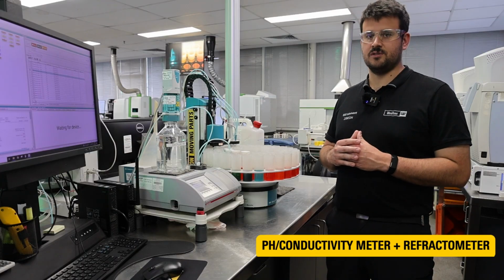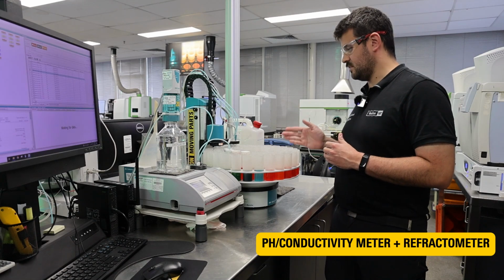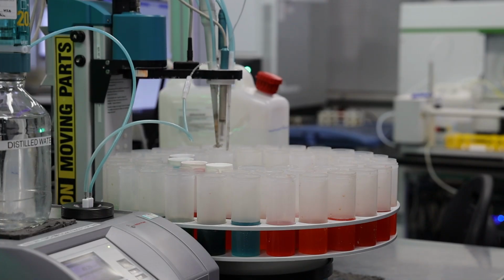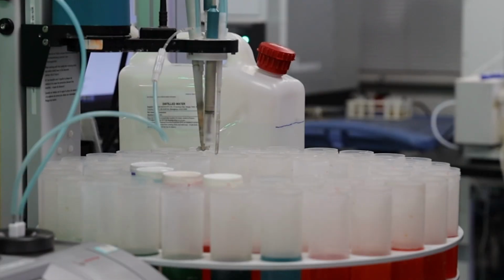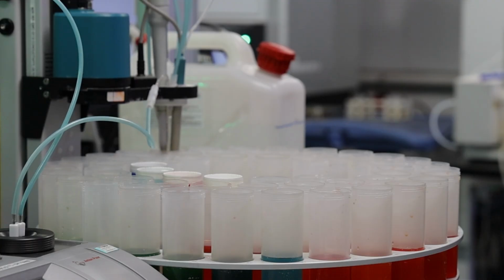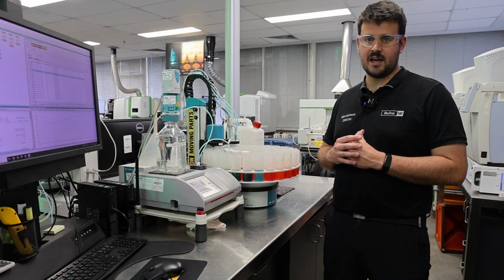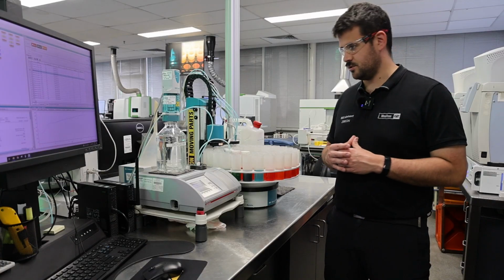Some of the other tests that we do here on coolant samples at the WesTrac SOS lab are pH conductivity and refractive index. pH conductivity is fairly simple. Two probes go into your sample and they're able to give us a reading on both the pH and the conductivity of your coolant sample. Like the other tests that we do, this test can give us a snapshot on the health of your coolant sample, making sure that it's at the right specifications and at the right health to ensure that your machinery is running how it should and will continue running how it should.